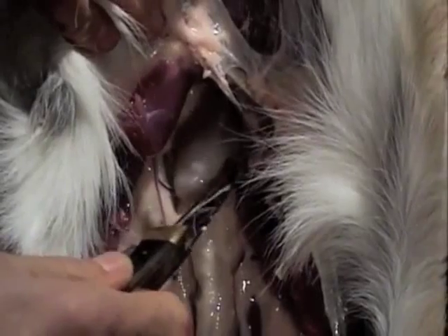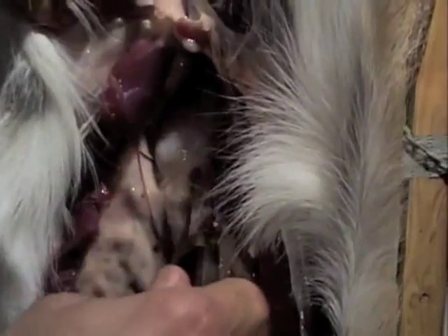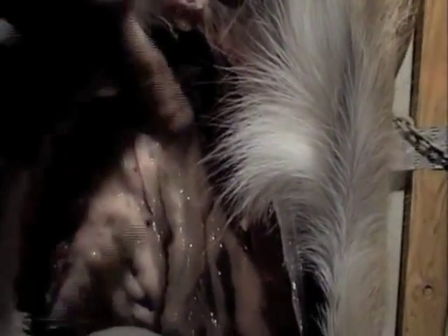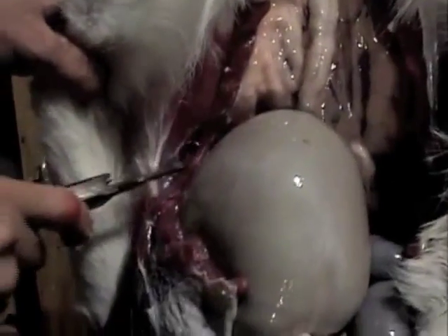This is the bladder — see the bladder, right there. Show the large intestine — right behind it, right there. That goes to the butthole. The large intestine is where all the water is recollected. All right, let me get on this side now.